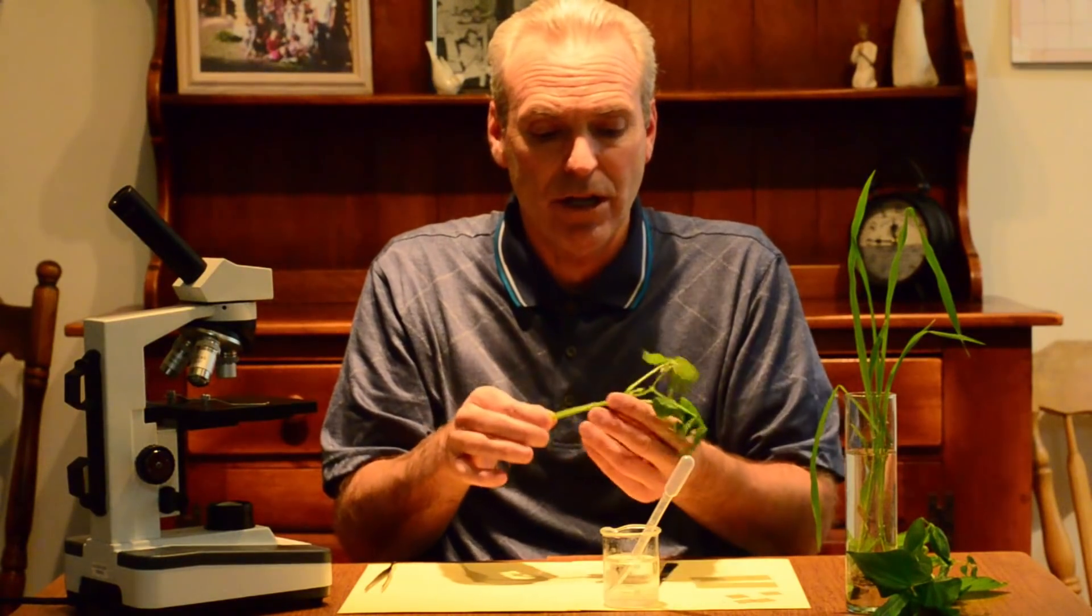And I'm going to show you how to cut the plant very carefully with a scalpel, show you how I want you to handle that, and try to get a very thin cut so the light can pass through it and we can observe those parts and those pieces through the compound light microscope. And I know you know how to use those really well. So I'll have you come on in here and we'll take a look at how to obtain those pieces, those parts to examine.